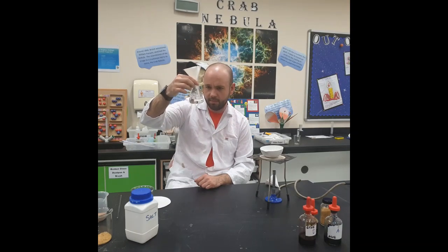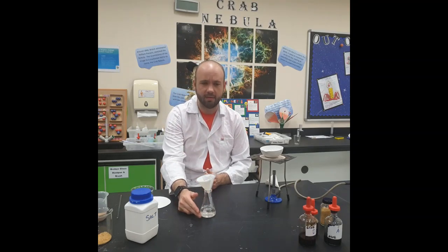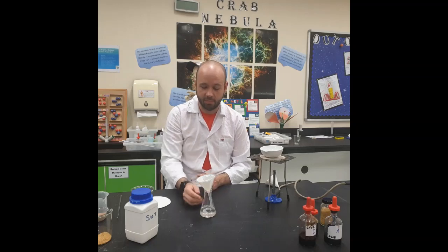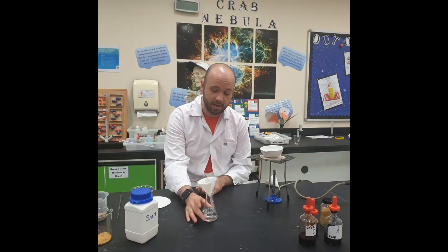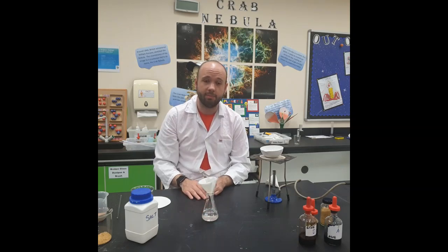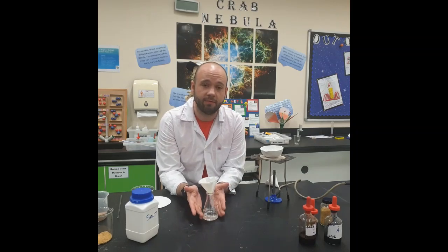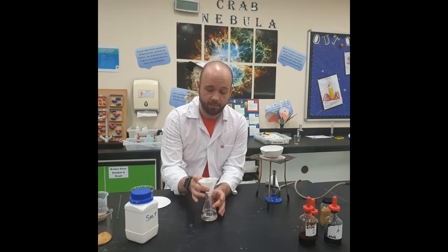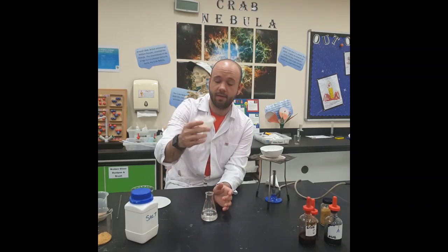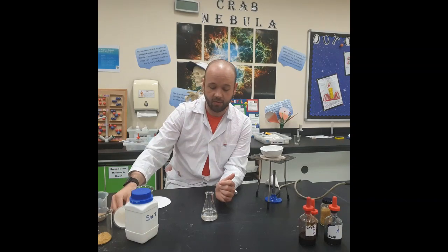Now, because the salt is soluble, what we will have down here is salty water. The particles are small enough to get through the filter paper, and they form a solution at the bottom in our conical flask. What do we call this solution that forms in our conical flask? This is known as the filtrate. Okay? Now, remove the funnel with our residue in, because that is the sand on its own now.